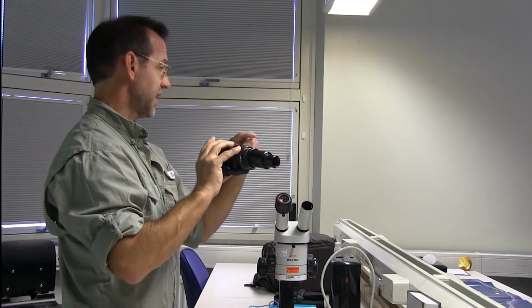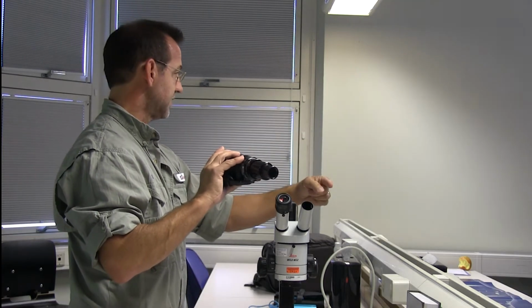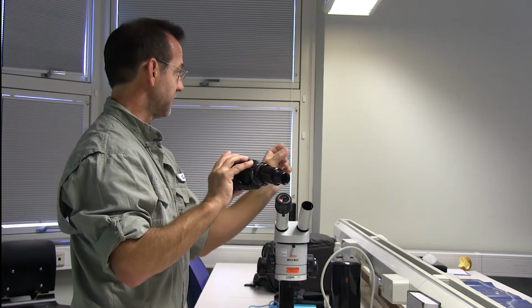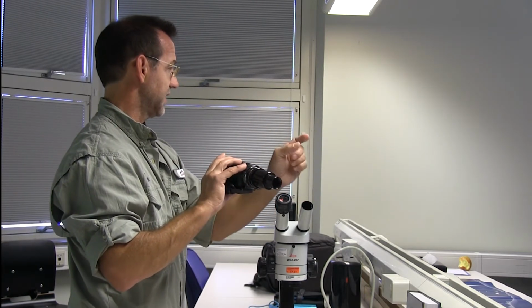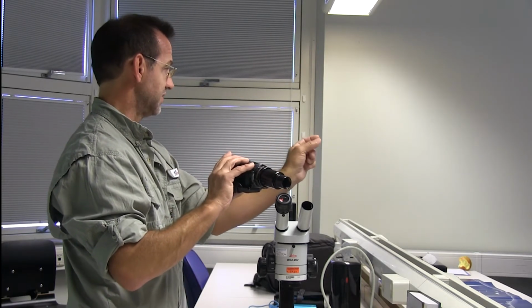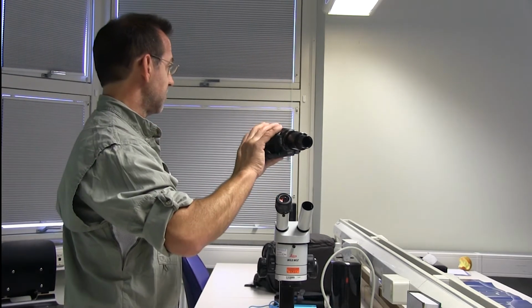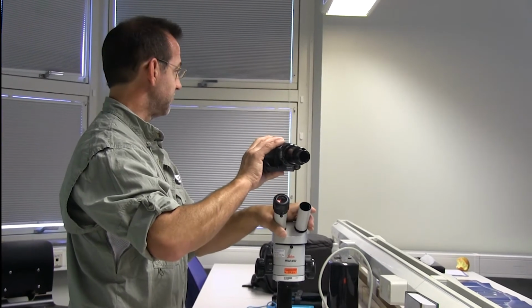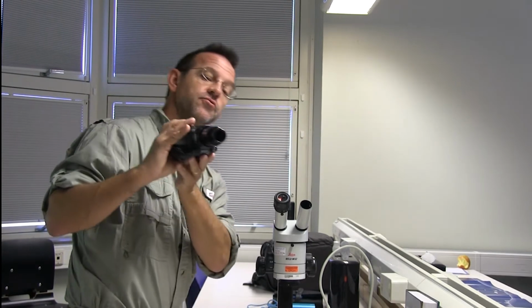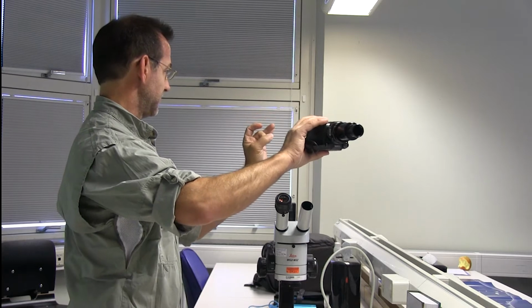So you're kind of using more than the magnification of the microscope. It's hard to get an exact estimate of what the size of the organism is unless you measure everything ahead of time and you have a standard. So when you zoom in, you know how big the organism is, because you're zooming in farther than what the microscope is doing at low power, let's say. If you zoom back out, that's not the picture that you want. You don't want that little circle there. You just want to fill the screen.